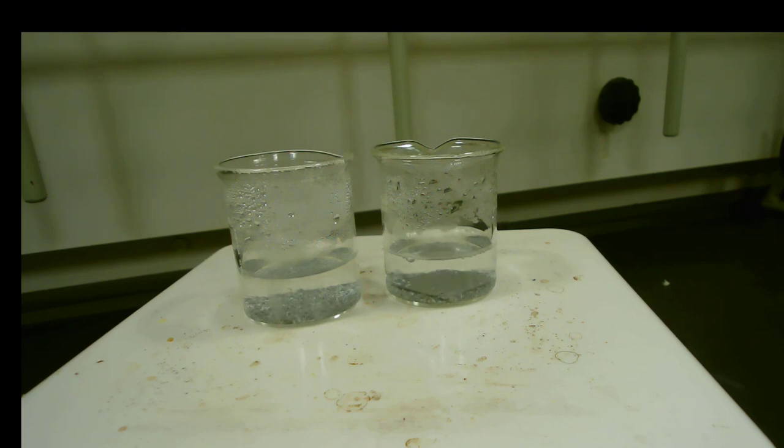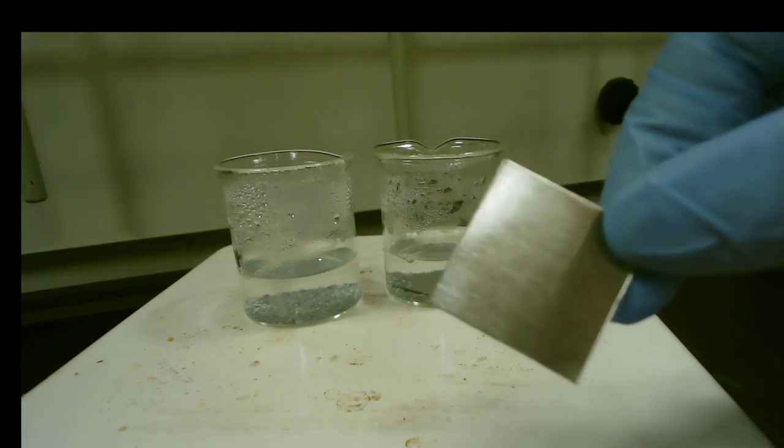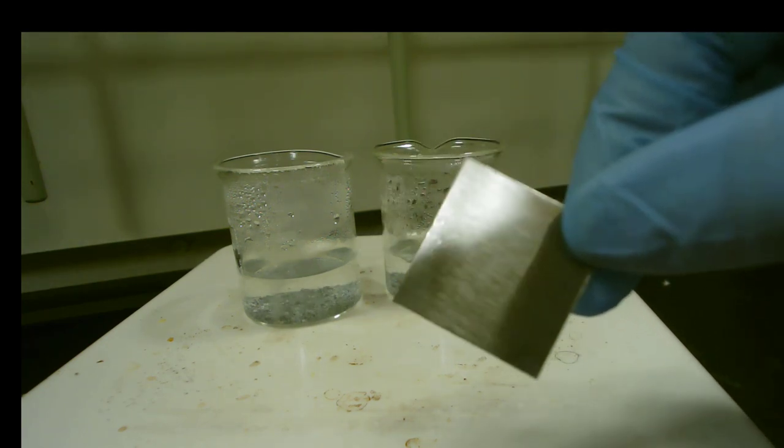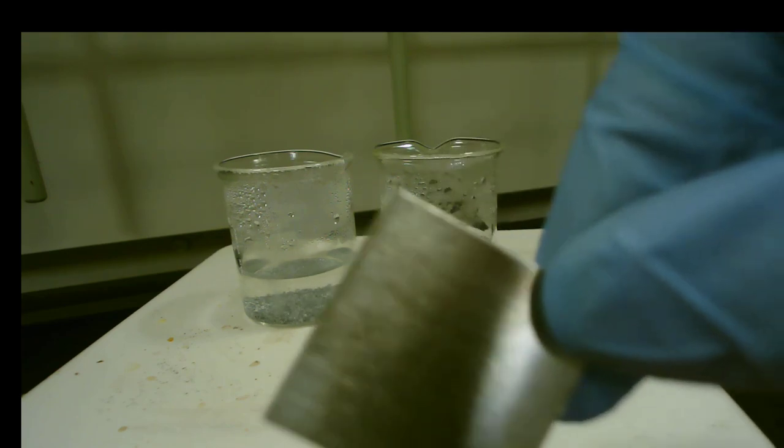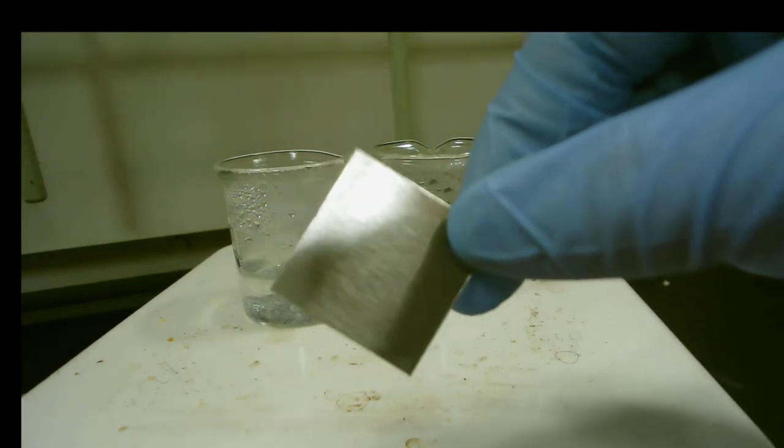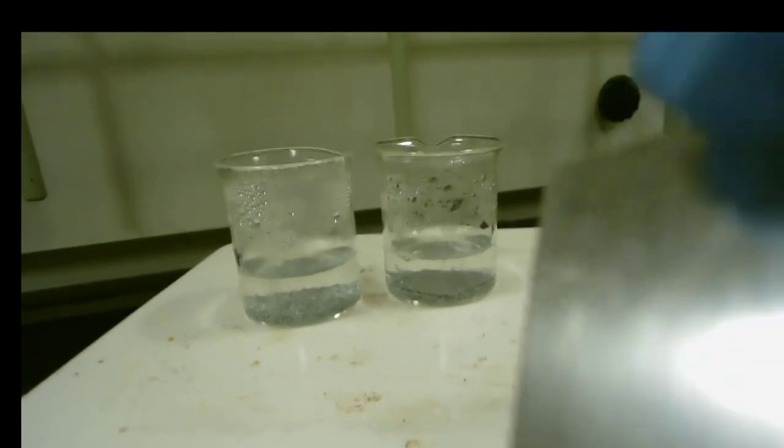This is the new color now that it's been taken out, rinsed, and dried. Dexterity is challenging.